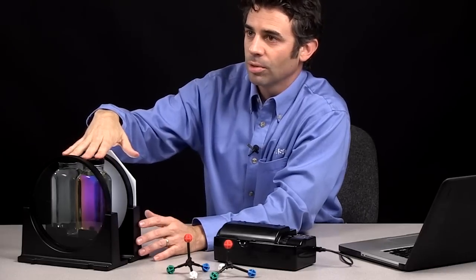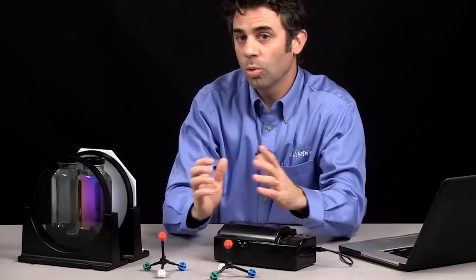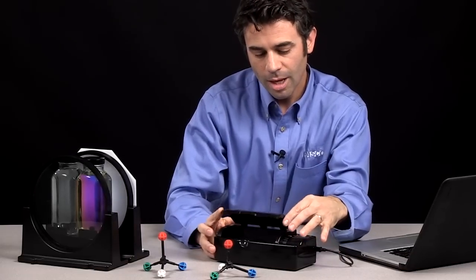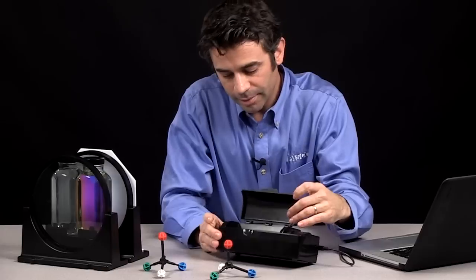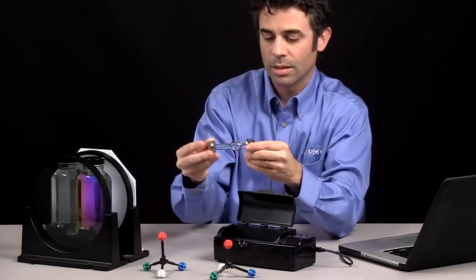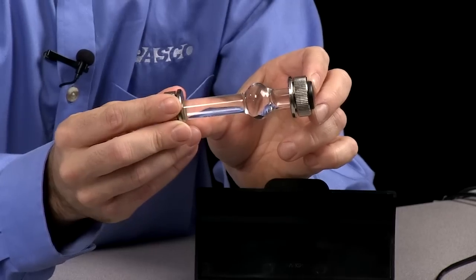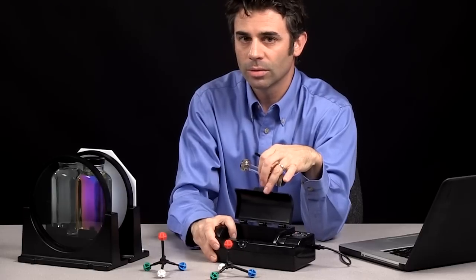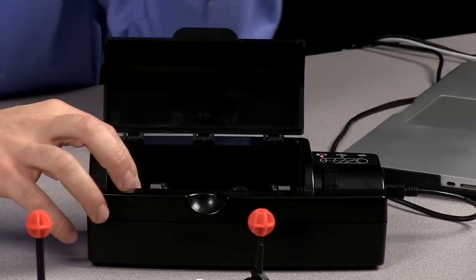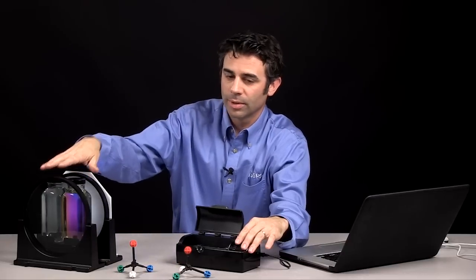That's what I mean by rotation of plane polarized light — this sample is rotating the light, and the water is not, because there are chiral centers in the compound. Now, to quantify that, we're going to use our polarimeter. Simple power button right here — it can be connected via Bluetooth or USB. Inside, there is a sample cell holder, and here's a sample cell. This sample cell just has water in it, but it's a 100 millimeter sample cell with quartz ends so it won't affect any of the light. Inside the polarimeter, there is a 589 nanometer monochromatic light going through a polarizing film on one end and a polarizing film in front of a detector on the other end that I can rotate around.